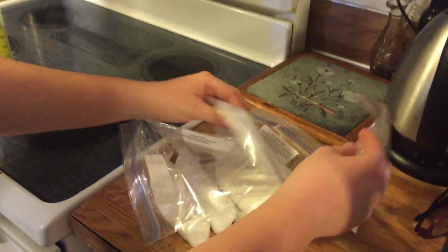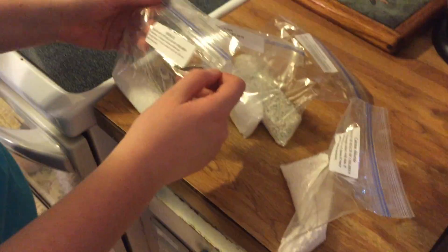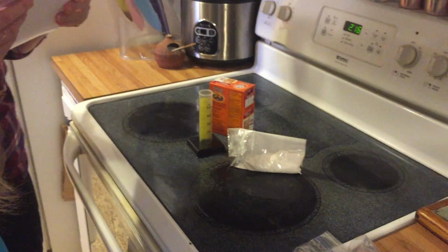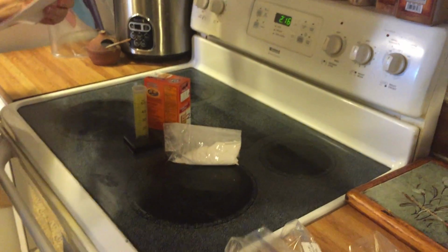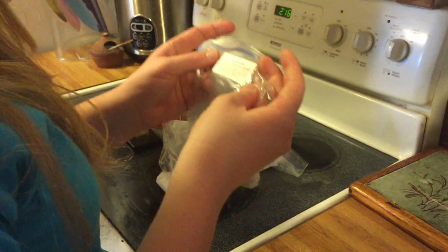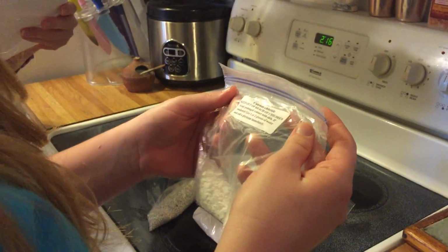Do you see the plaster of Paris? Okay. Oh, that's this one. Okay, do you see baking soda? We might have to provide our own baking soda. No baking soda. Okay, let's provide our own. All right, and what else do you have there? There's borax. Okay, great. And Epsom salt. Great. And ammonium sulfate. Good. And calcium chloride. Okay, good.